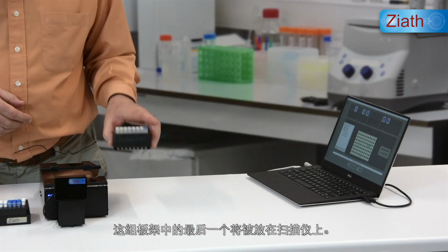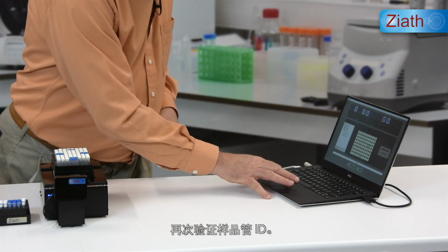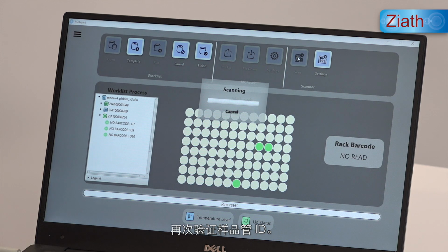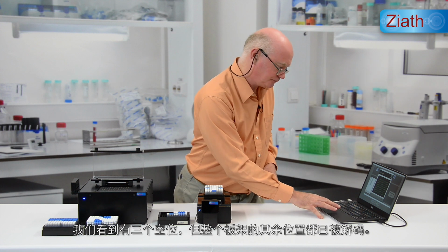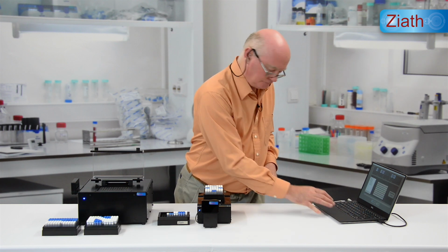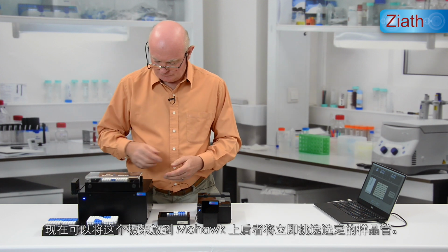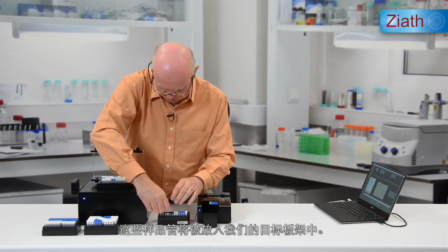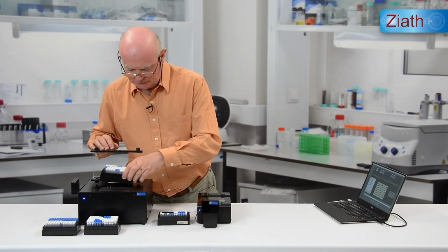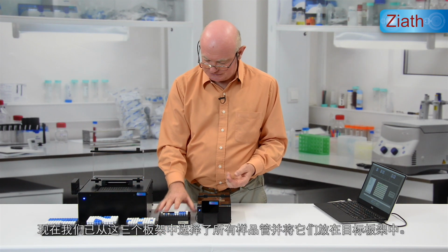And move on to the final rack from this group. Placed on the scanner. Again, tube IDs are verified. We see we have 3 empty positions, but the whole of the rest of the rack has been decoded. That rack goes to the Mohawk. It immediately picks the selected tubes, which go into our destination rack. So now we've selected all of the tubes from these 3 racks and placed them in a destination rack.